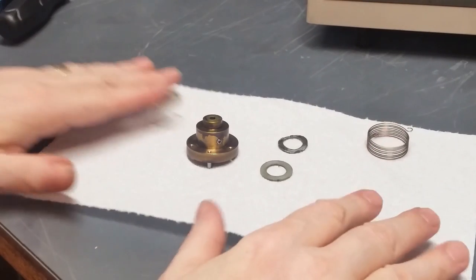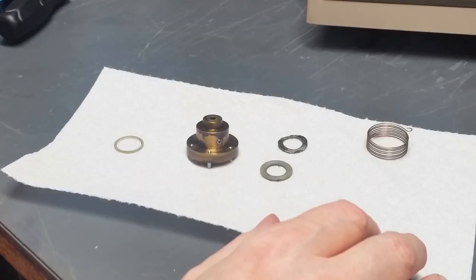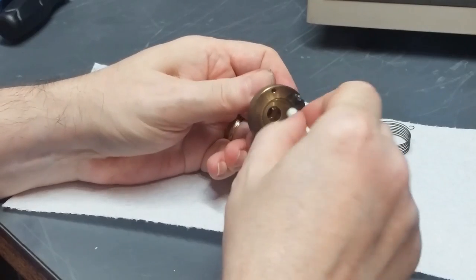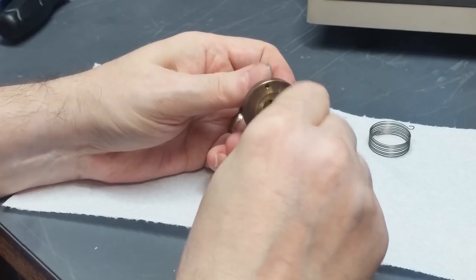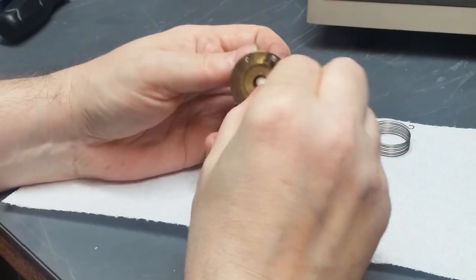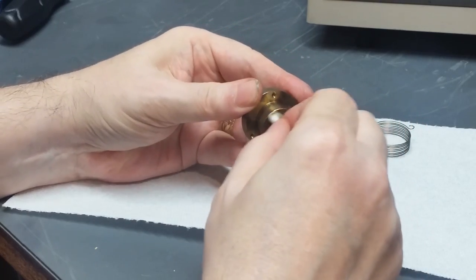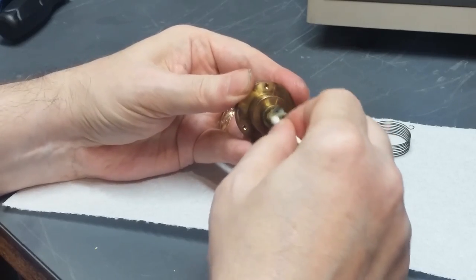Okay, let's clean these parts up and get them ready to go back in. We're definitely on the downhill side of the slope on this. It won't be long before this thing is done. I'm going to clean out in here where this thrust washer used to be. Down here, you can see there's definitely stuff in there coming out. Around here, there's another thrust washer. It's right on this surface here. Let's get this stuff off the end.